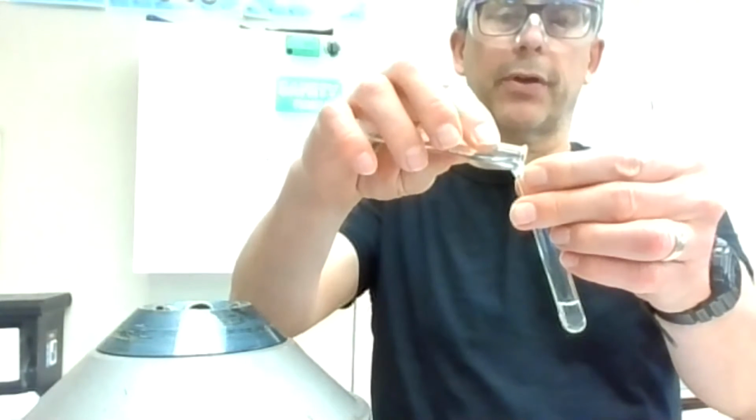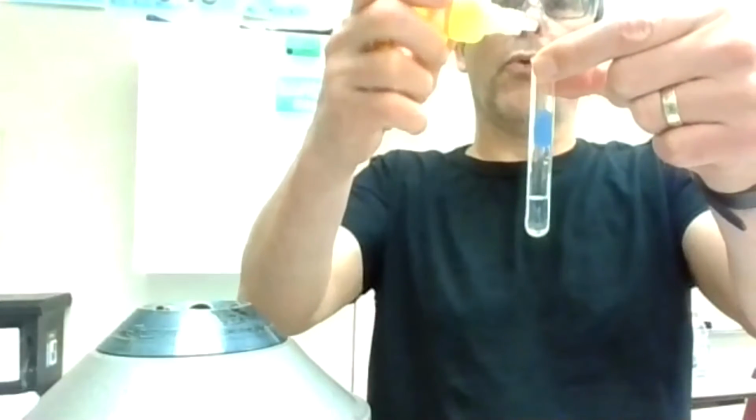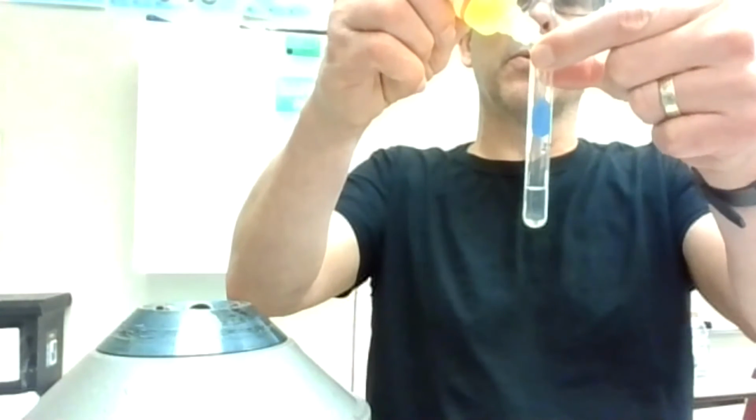Okay, so I'm going to take out this magnesium. Notice the fluffy stuff on the bottom and the liquid on the top, trying to keep the fluffy stuff down there. It should stay there. Okay, better to leave a little liquid behind than carry that fluffy stuff with me. And now I've got the rest of my ions. And to that, I'm going to add CrO4 minus 2.